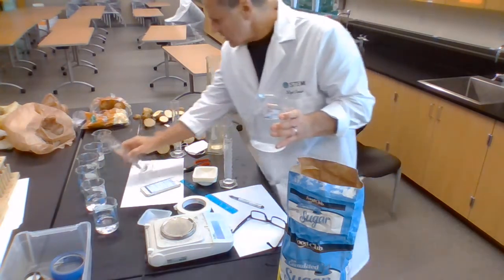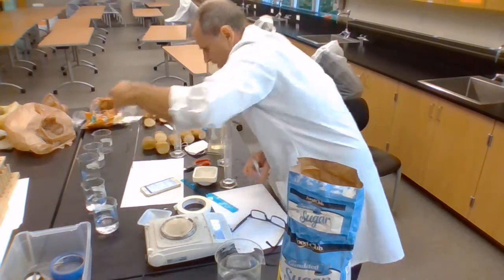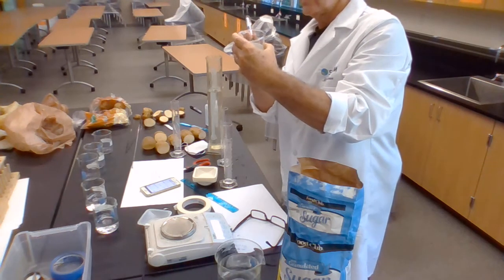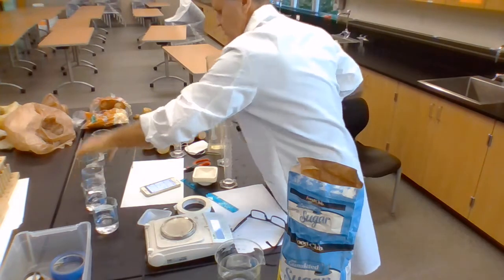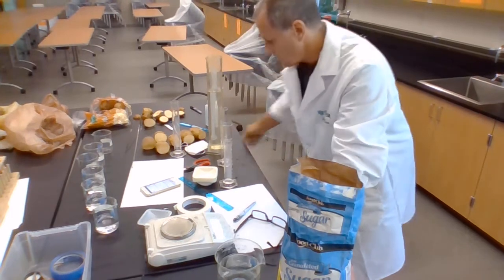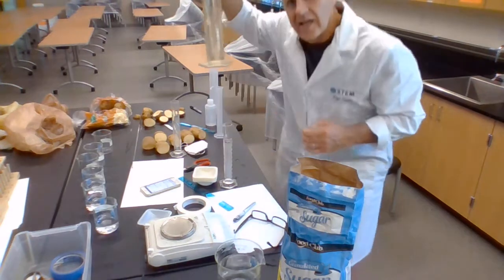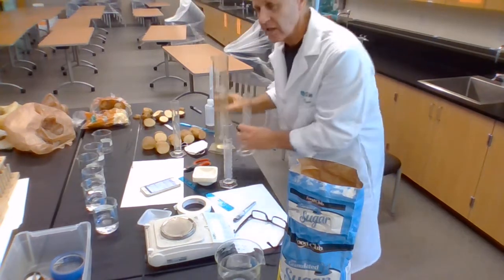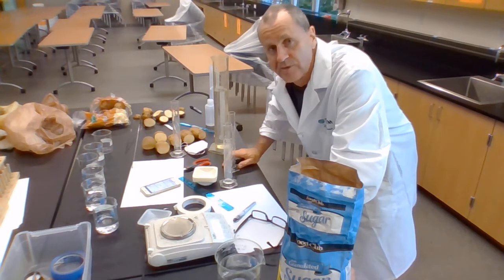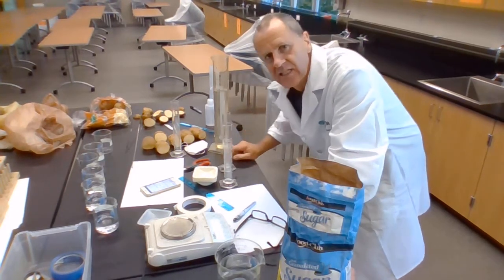Oh, so that's nice. That's my 0.06 molar sucrose solution, and I forgot to write my label on it, so that's 0.06. The next one I do is 0.04, where I will put 40 milliliters of my stock solution of 0.1 molar, and I'll add 60 milliliters of the water. The last, 0.02, I'll fill this up to 20 and add 80 of water.